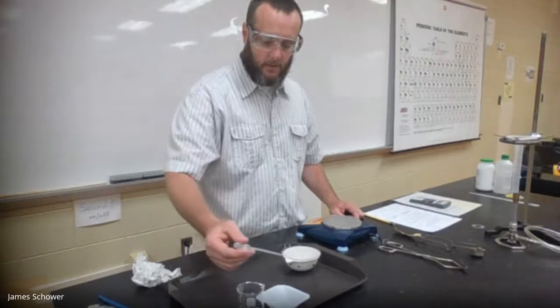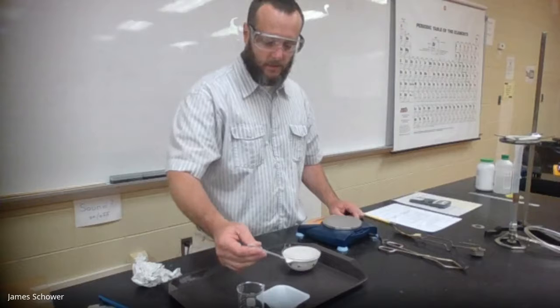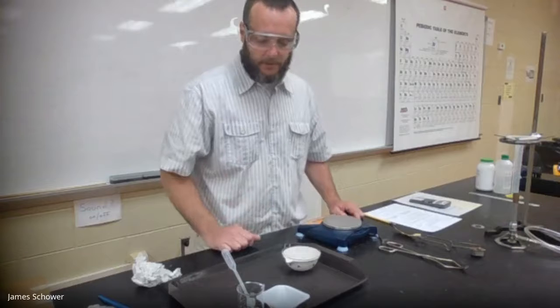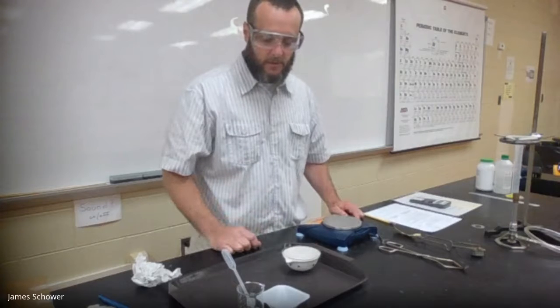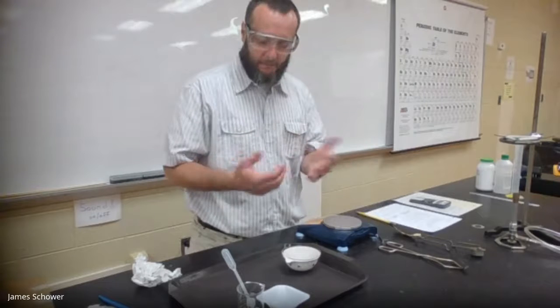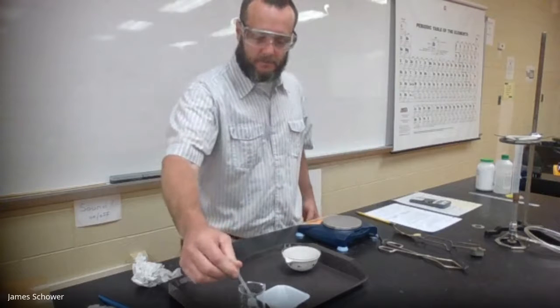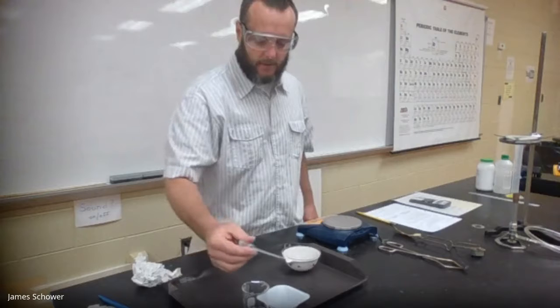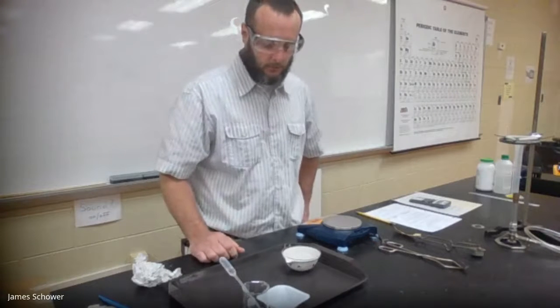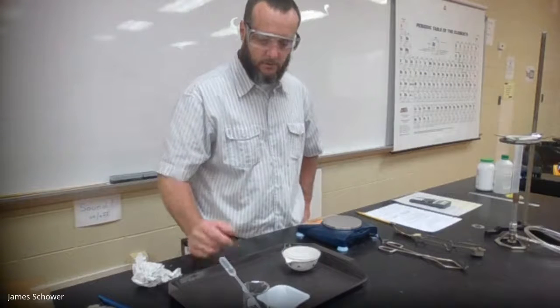I'm going to carefully add the acid, and it's going to begin to bubble quite rapidly. Now, the evaporating dish is covered by the watch glass to allow all the salt to stay in. It's going to capture all that salt. I'm going to keep adding it until there's no more bubbles being formed. Do a little at a time. There's no rush.